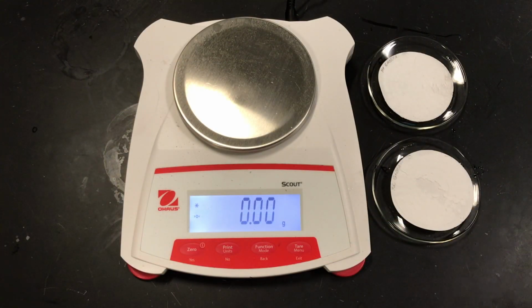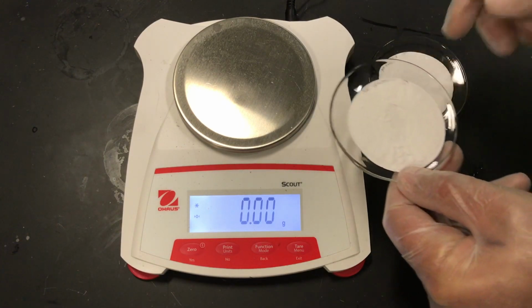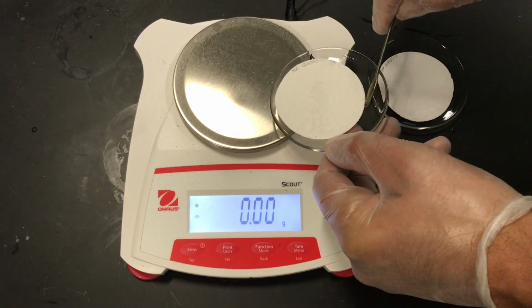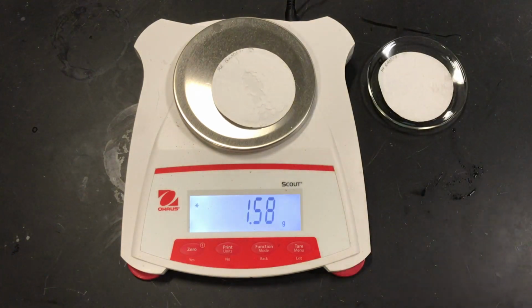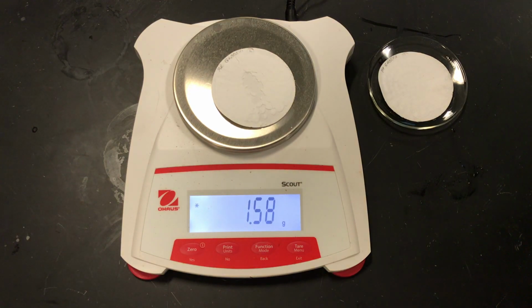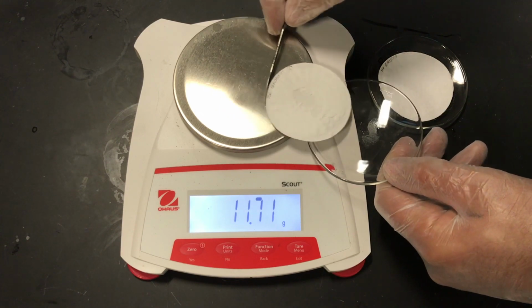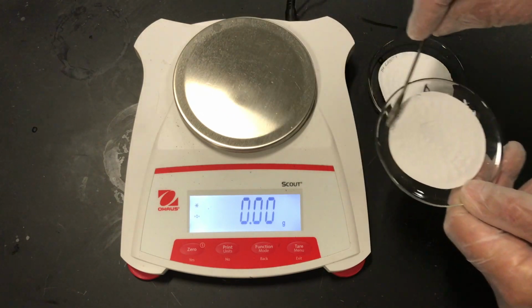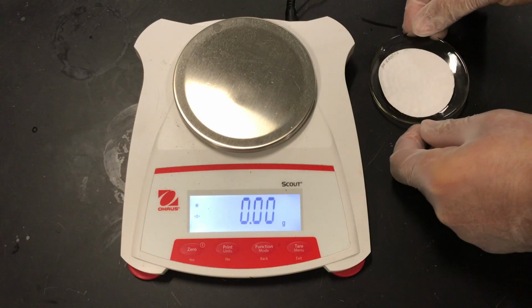So we're going to take sample A. It is now dried filter paper and dried calcium carbonate. We're going to carefully try to remove that onto the scale. We have re-zeroed it. 1.58 is the mass of our filter paper and our calcium carbonate. Subtracting out the filter paper earlier, you should have the mass of your calcium carbonate for sample A. And that, of course, is important in order to know the moles of calcium carbonate. And working backwards, we get the moles of the carbonate ions in solution that came from the metal 1 carbonate.